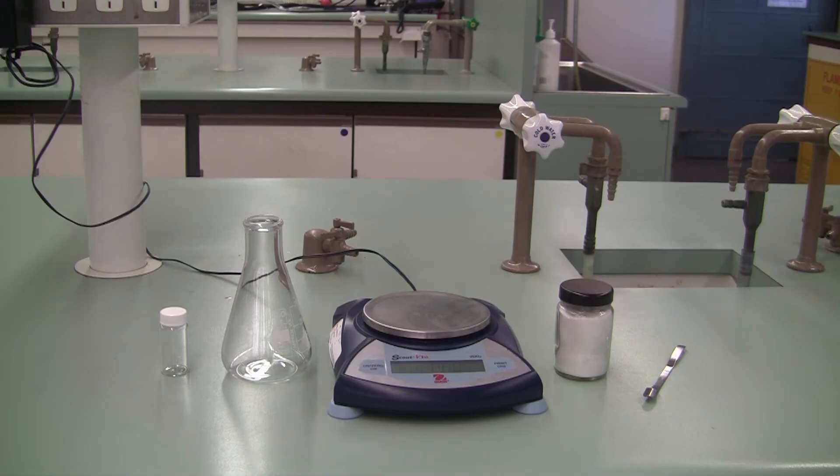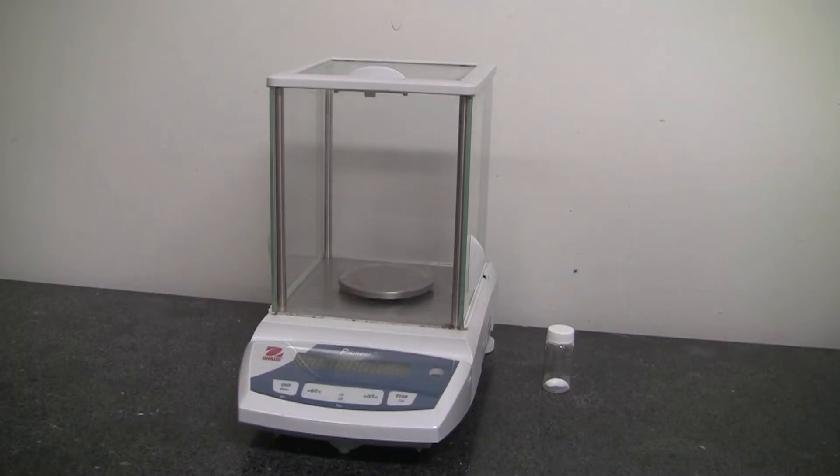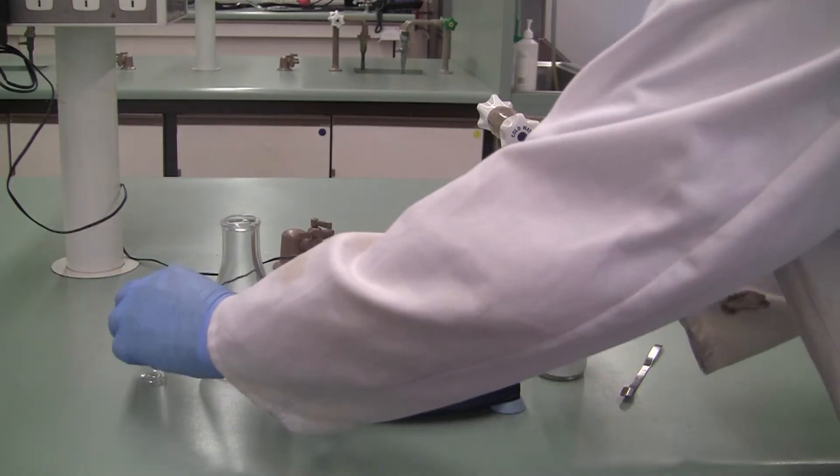In this video, we're going to learn how to weigh by difference using the top loading balance and the analytical balance. To weigh by difference, start by taking your weighing vial.